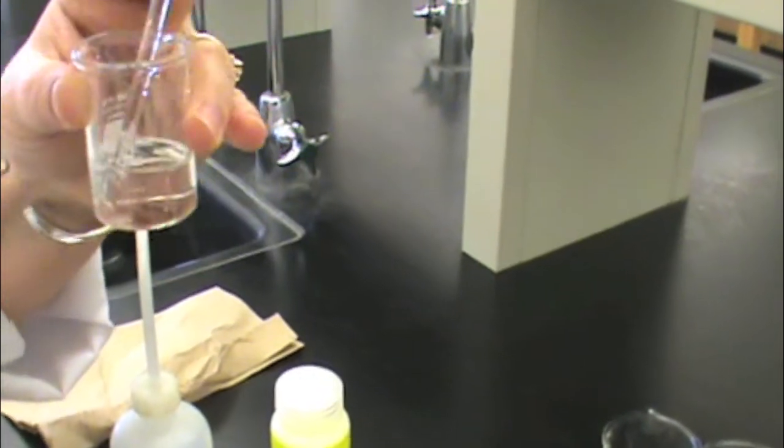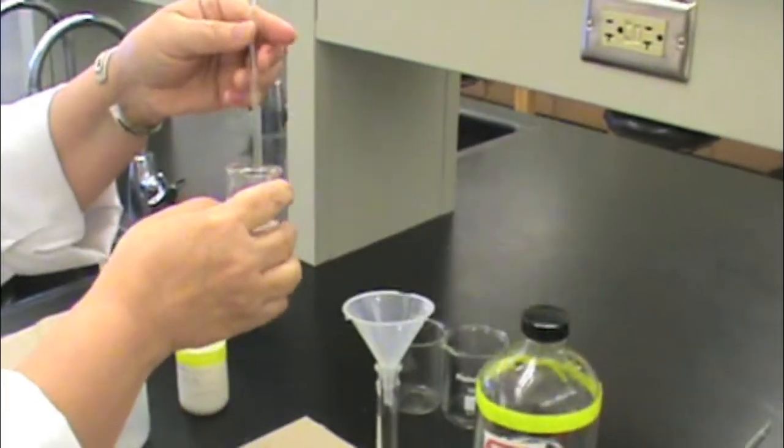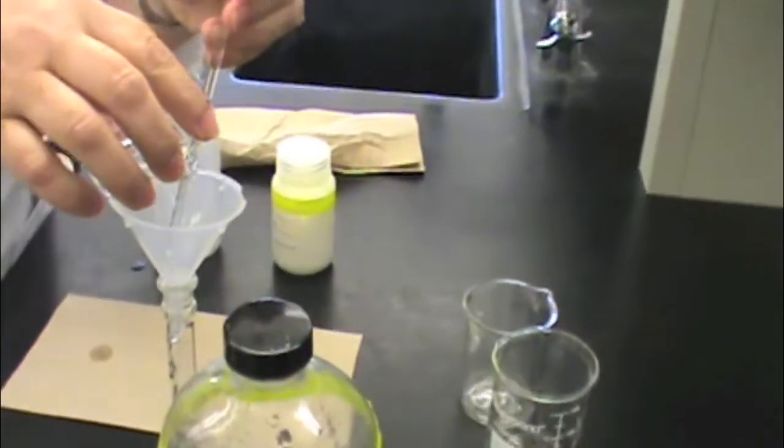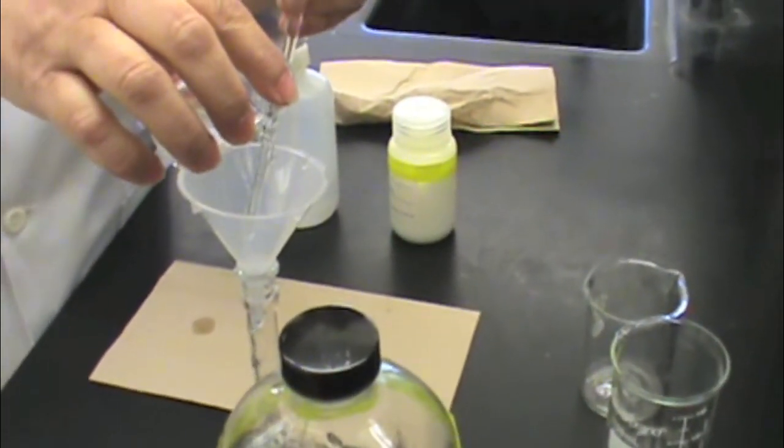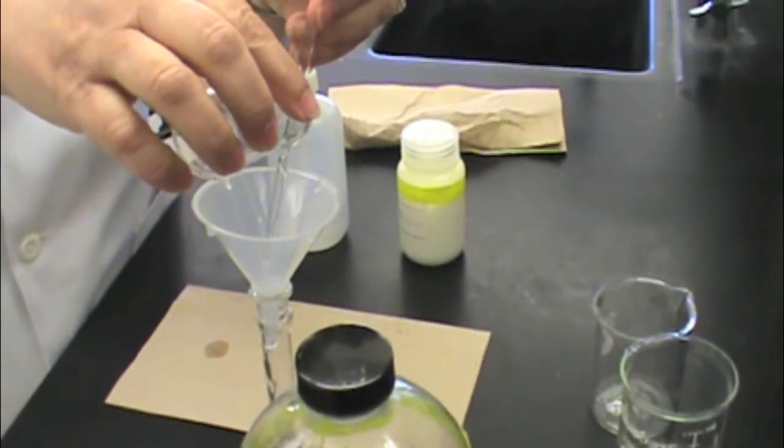When your solid is completely dissolved, take the glass stir rod and place it into the funnel. Then pour your solution along the glass stir rod into the funnel.